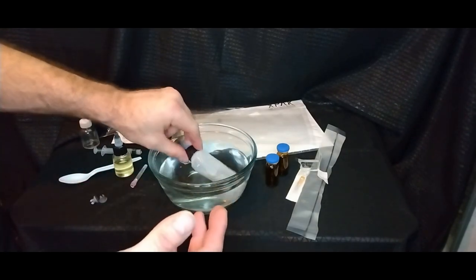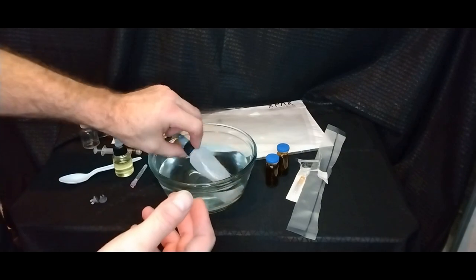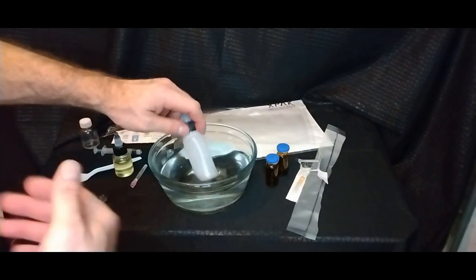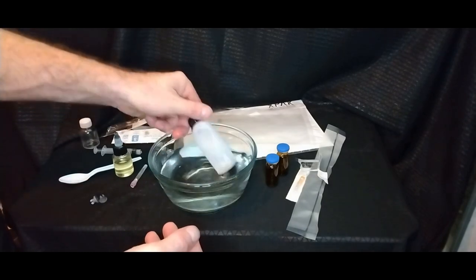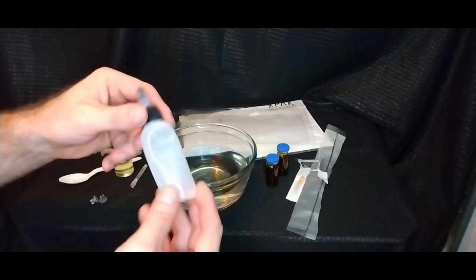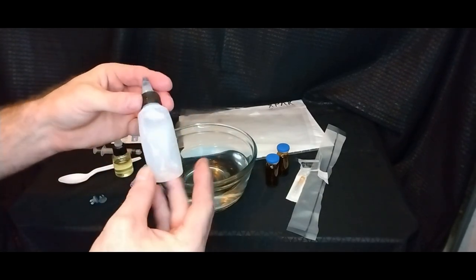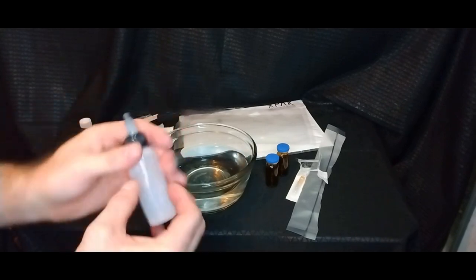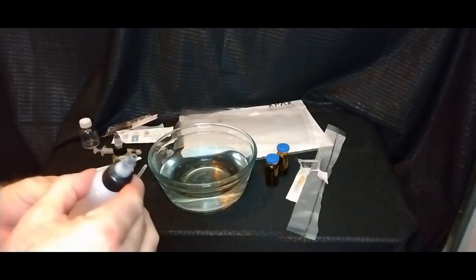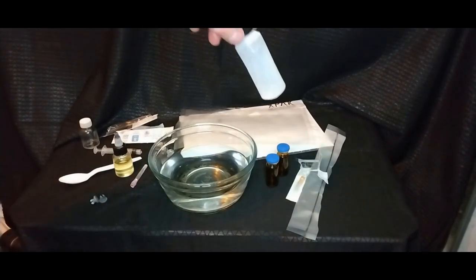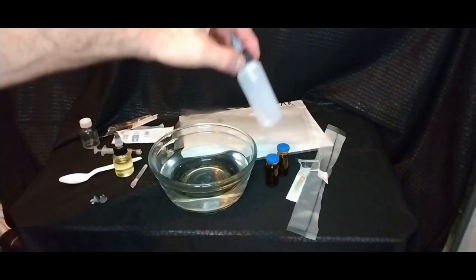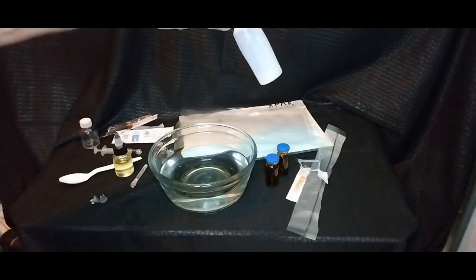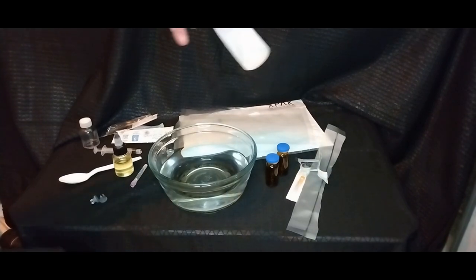So, water-based is the easiest to work with but also you don't get the best results with certain things. Say like with oxytocin or IGF-1 native the 70 amino acid version. So, this is what that's for is to make those products actually live up to their potential and release slowly over time. Okay, well I'm going to call that what we do have. Let me see if we've got that in the shot. Ah, it's just hard to see through the lighting there but it's fairly fairly well resolved down at the bottom there. All right.